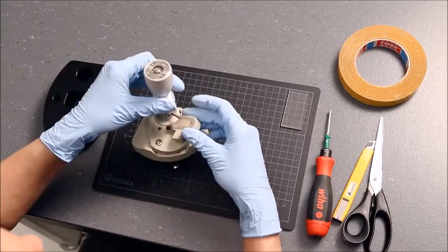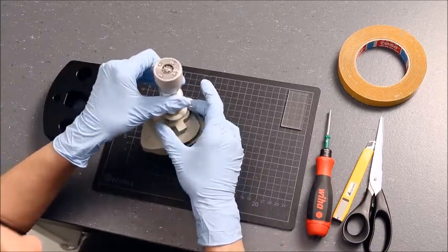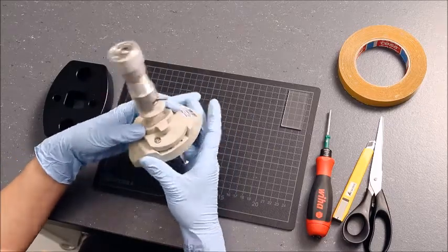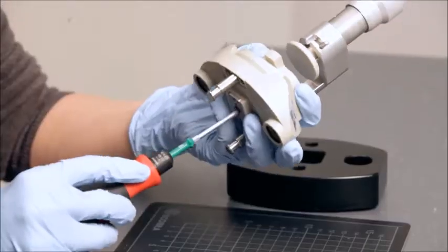Place the insert in the clamping cell and fix the sample holder from the back using the Torx T20 screwdriver.